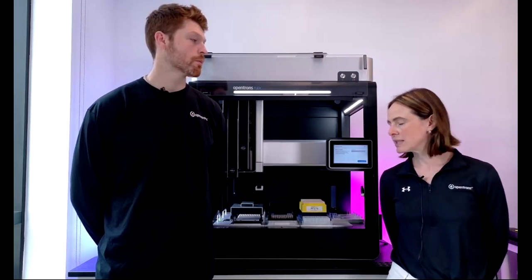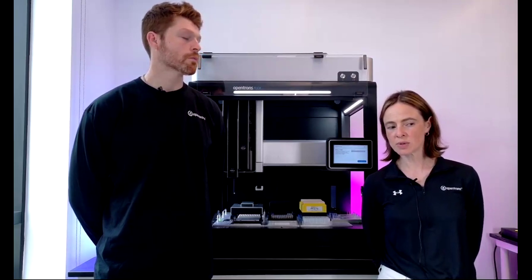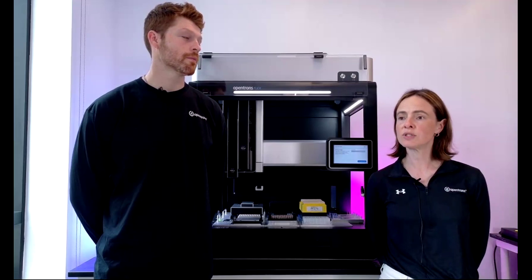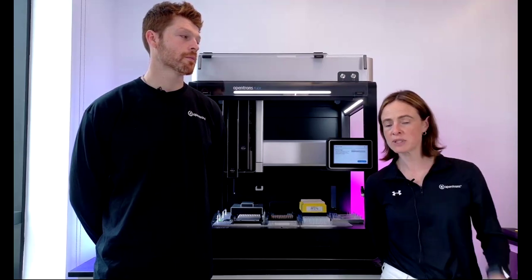Can you specify the pipette tip depth in solution for aspiration or dispense? If I understand this rightly, it's asking whether there is a standardized height. Do we think that's the question? I think what they're getting at, and forgive me for stealing the mic here, is can you specify where in the well to aspirate or dispense? Oh, I see. Yeah, that's extremely configurable. You can specify the height and also the position, the X and Y position in the well as well.